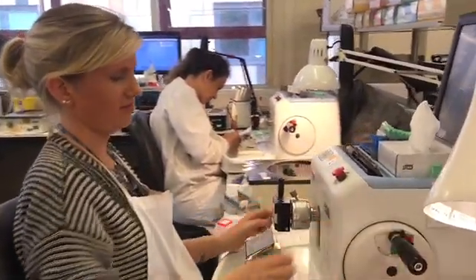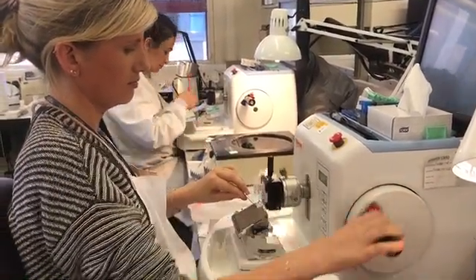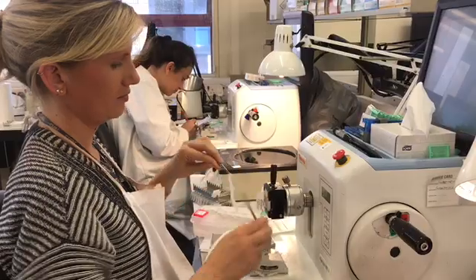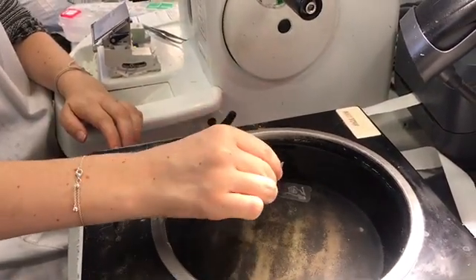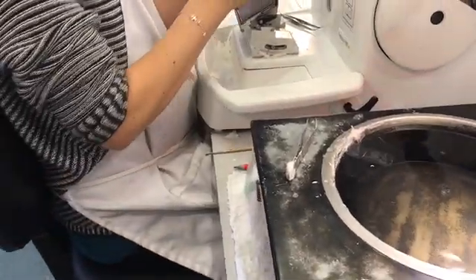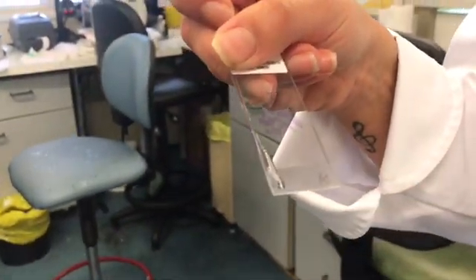Basically, those tissue samples that the pathologist took during the cut-up and dissection are put into wax blocks to allow us to cut one-cell-thick sections, that are then floated into hot water and picked up on a glass slide. In order to be able to see that section under the microscope, you need to give it some colour, so we need to stain that section, and the routine stain we use is called haematoxylin and eosin, where we can then visualise the sample under the microscope.